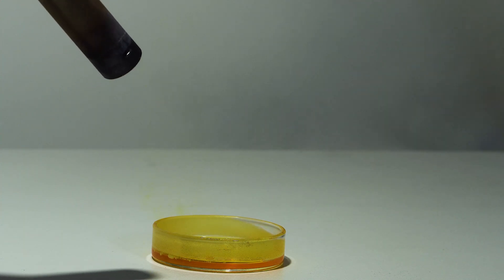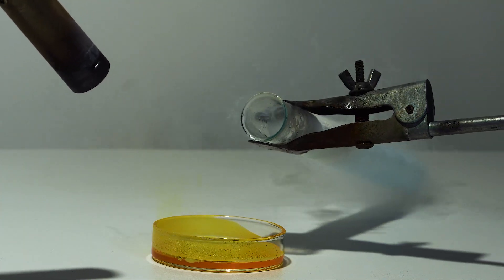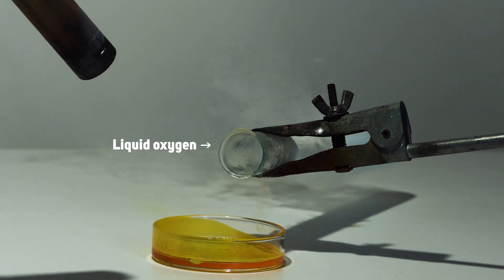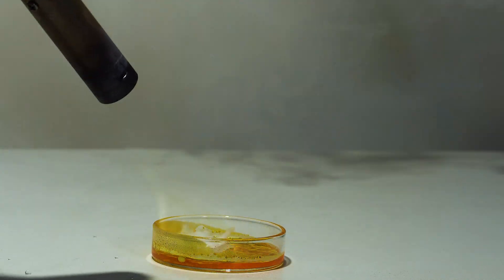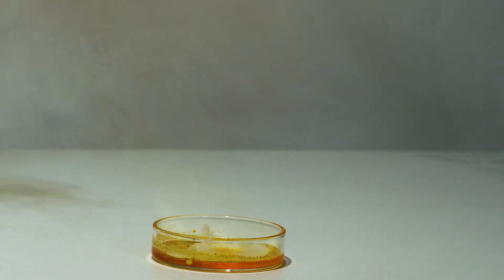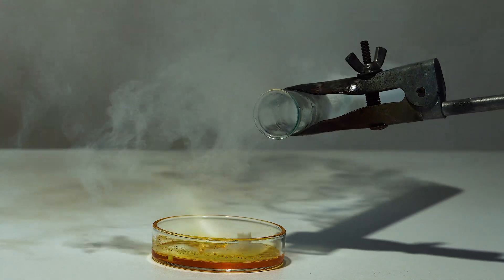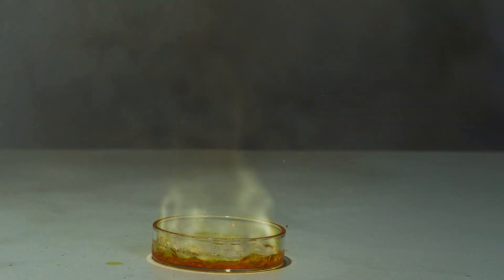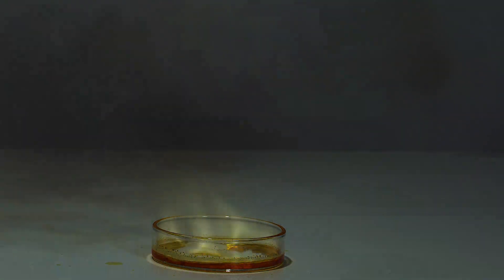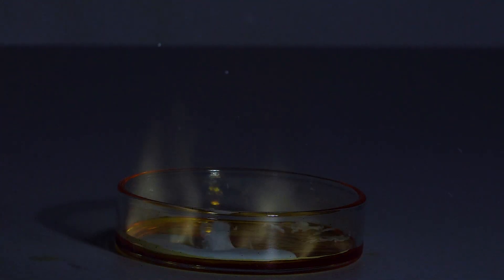Disulfur dichloride is capable of burning, but it does this only in an atmosphere of pure oxygen. To clearly show the combustion of this substance, I used liquid oxygen. Here you can see that combustion occurs only at the point of contact between liquid oxygen and disulfur dichloride.